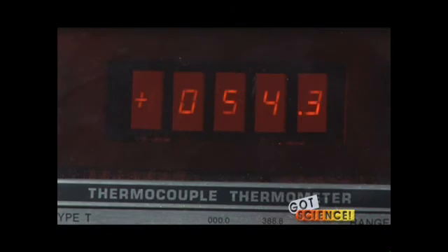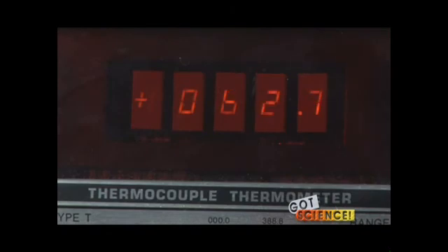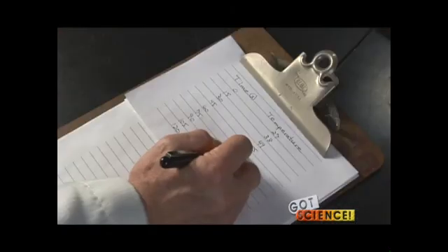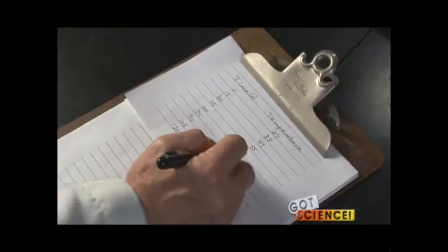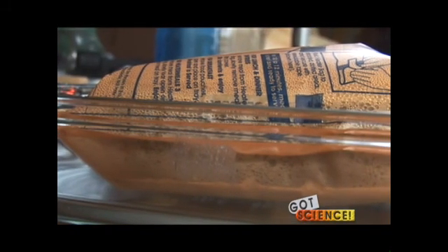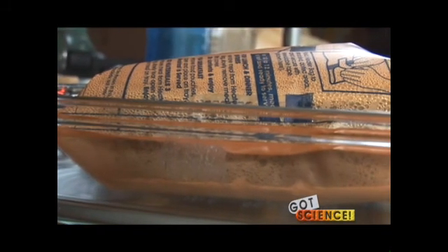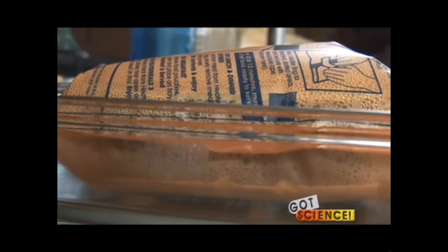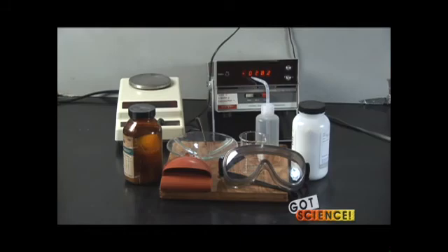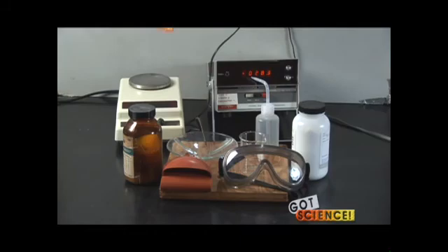During the investigation, you and your students will monitor the reaction using a thermocouple to record changes in temperature. A great deal of heat is released, so you'll need to use a tempered baking dish and should observe appropriate safety precautions. Be sure to monitor your students at all times.